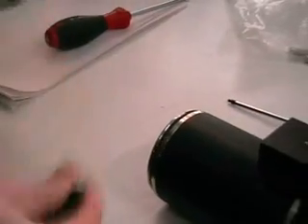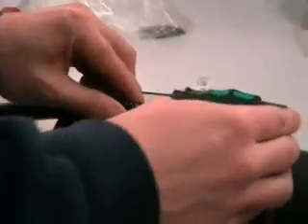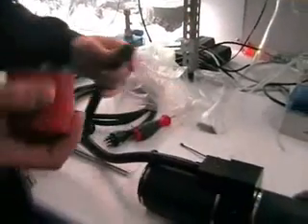The fiber optic cable has two rubber caps to protect the cable ends. The cable end with the notch, as shown, is inserted into the adapter attachment. Please ensure a secure fit. The adapter head with the rubber sponge is attached by clicking the cable end into place.